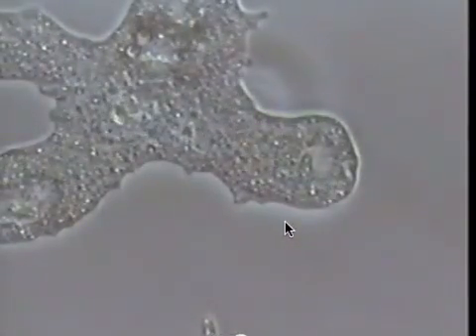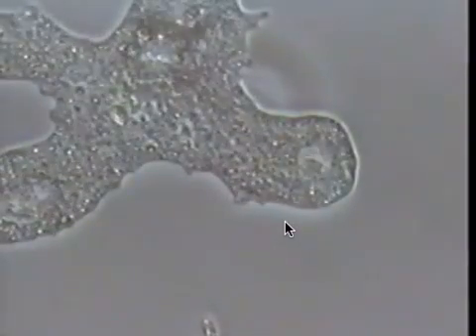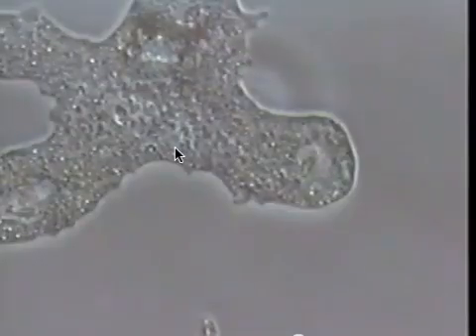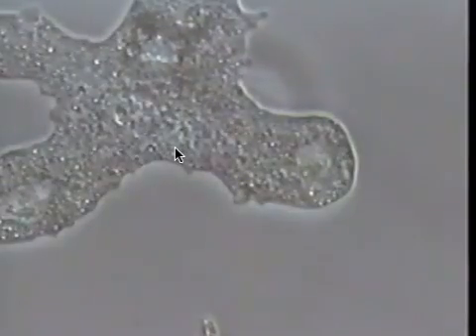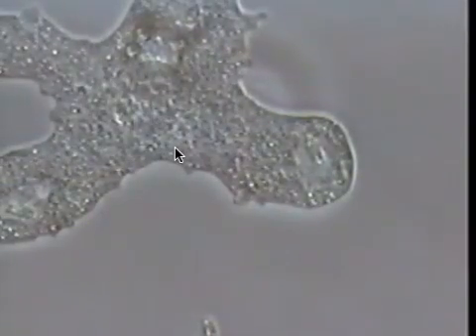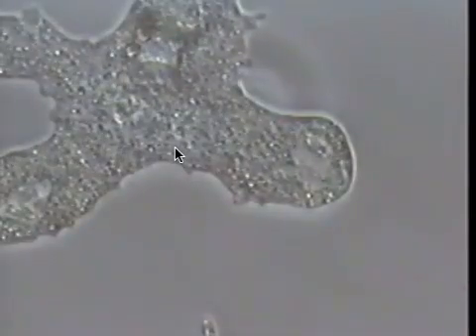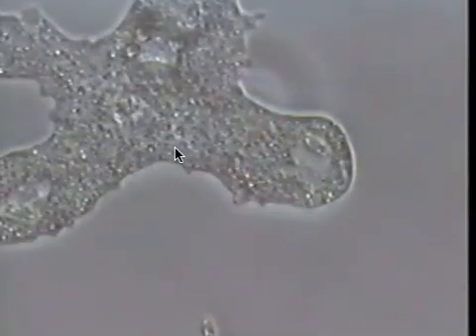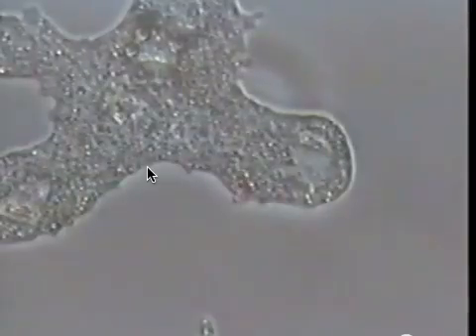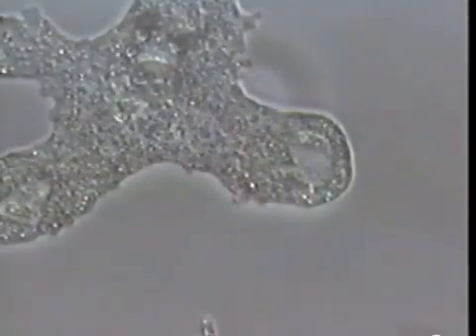Pseudopods is spelled P-S-E-U-D-O-P-O-D-S, and this is an amoeba under high power. All of the protists shown right now are under high power, so they'll be much smaller under low power when you're first searching for them. As you increase your magnification, you'll be able to see them in more detail like this.